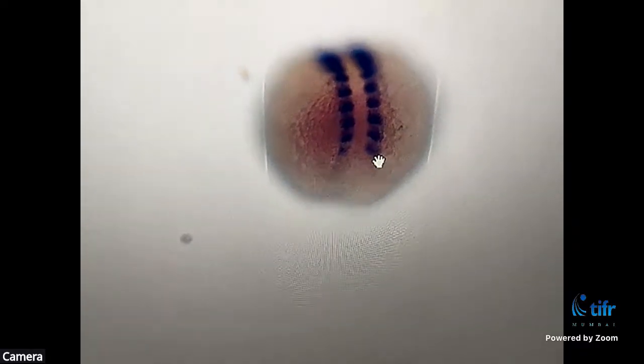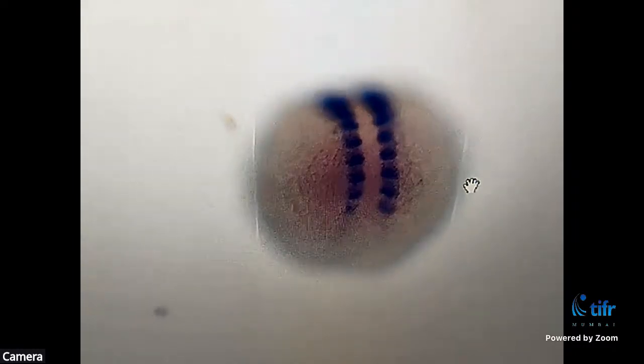This is the technique which I was talking about, which is in situ hybridization, where you can see that there are blocks of tissue that have been marked. So these are the same somites that I was talking to you about previously. In the previous thing where I showed you, you were just able to see blocks, but it was not at a better contrast as you are seeing it here.